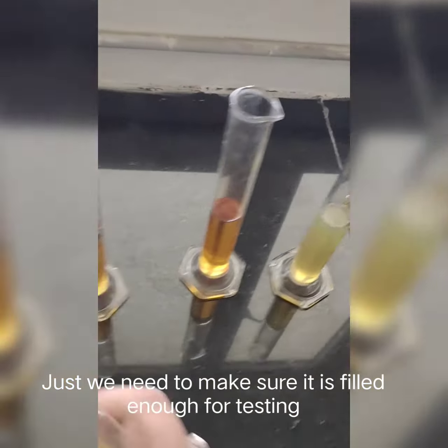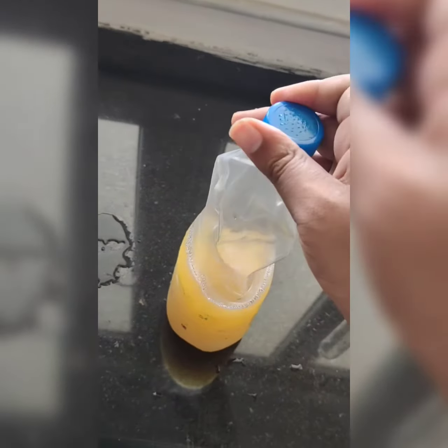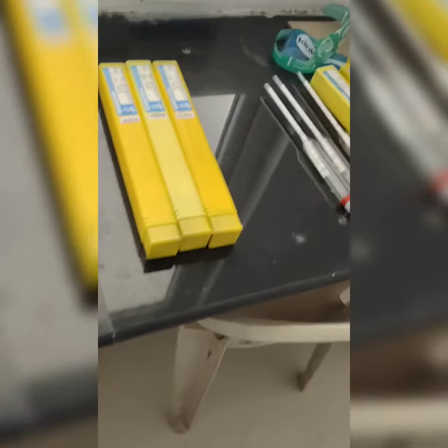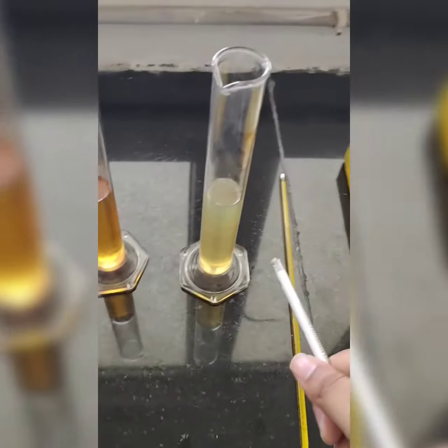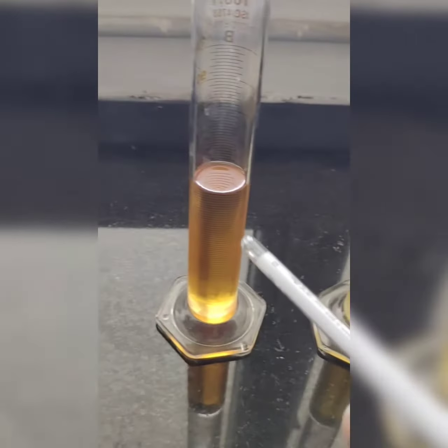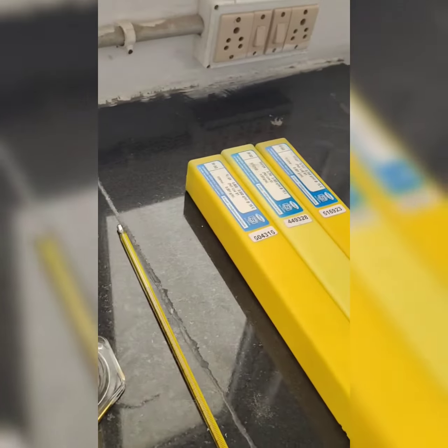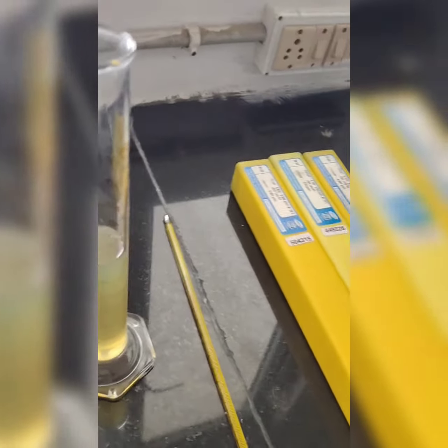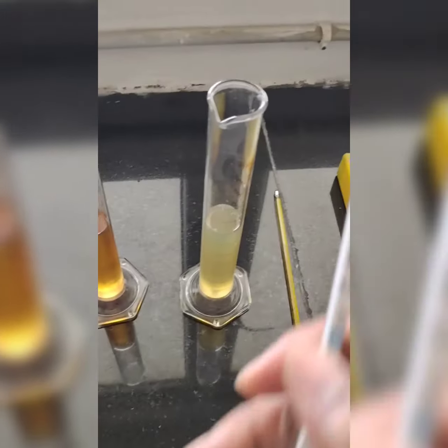So you can see the consistency of the third one which I have poured in it. It is dense and very thick. Now let's keep it. As this one is very dense, by viewing itself, by visibility only, you can observe that this one is very dense, this one is very light, and this one is in the medium range. So for the one which is very dense, we can use the hydrometer which is between 800 to 850.